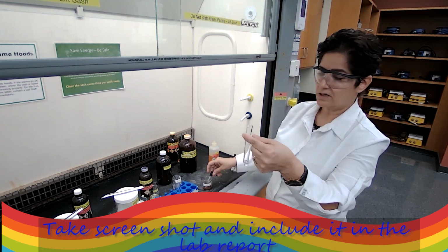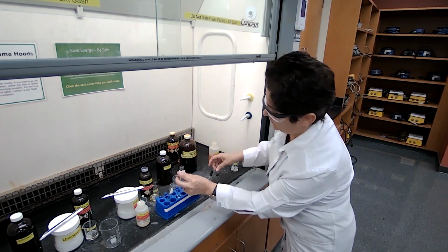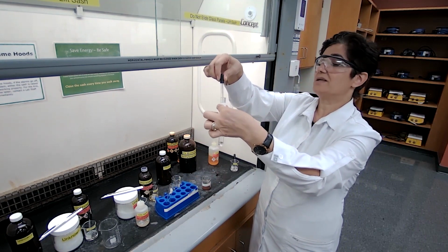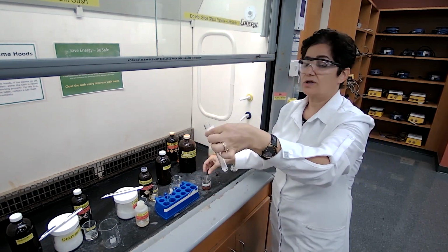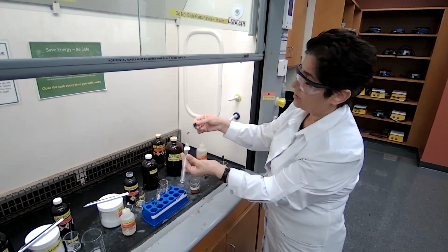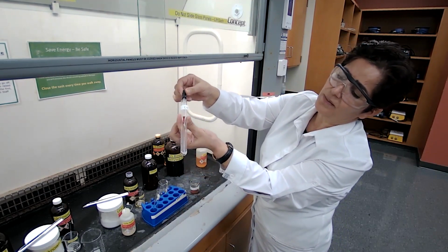So this is unknown 4. Try unknown 1 first. I'm going to add 1 drop at a time and see if it disappears or not. As I add the drop, going from the side, the color disappeared. If I add more, I'm just adding more for you to see it. For me, just adding 1 drop is good enough.